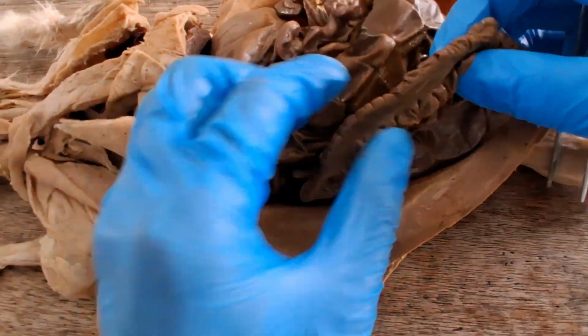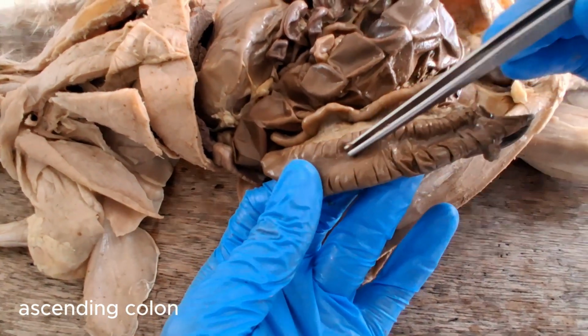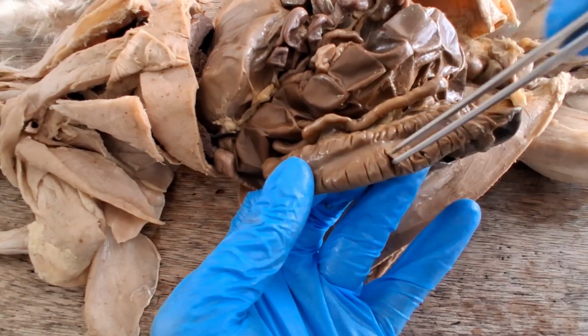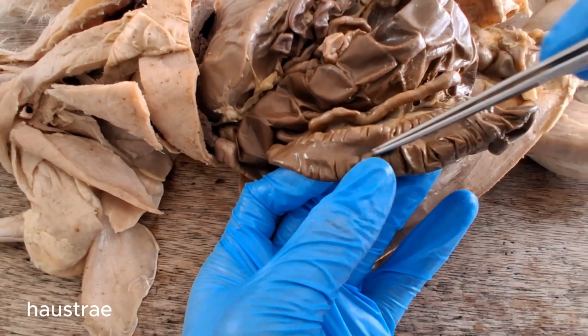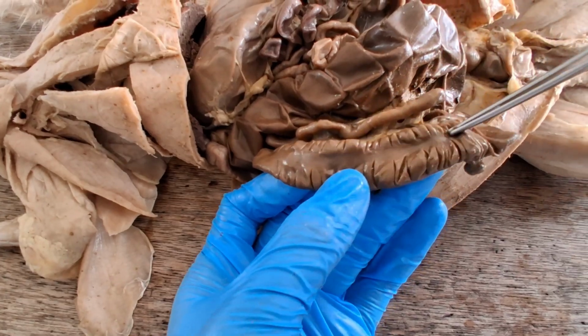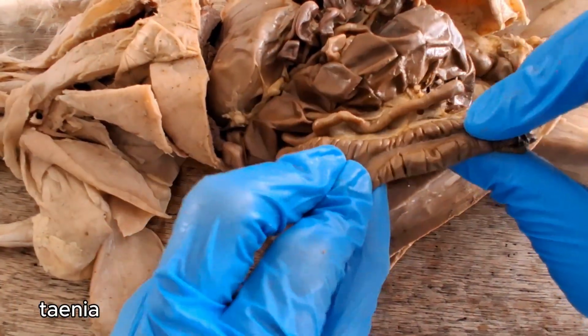So pre-digested food can go down into the ascending colon with all these haustra. The segmented appearance are the haustra. And there's a smooth muscle band here, longitudinally oriented, called the taenia. The taenia is on the ascending colon.